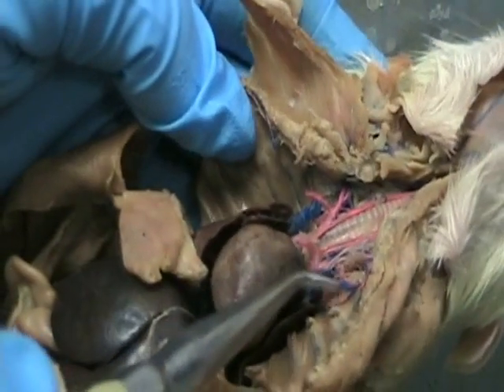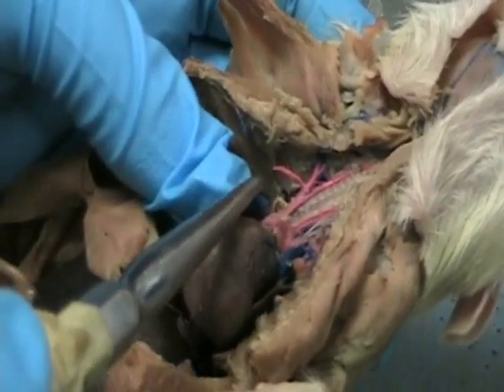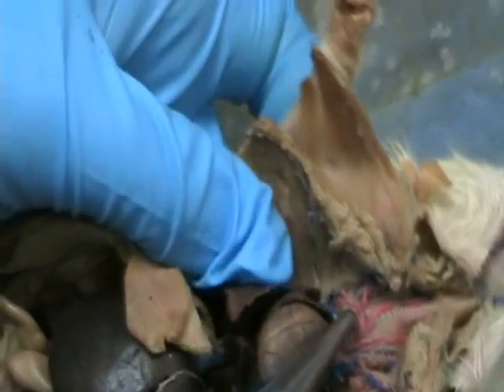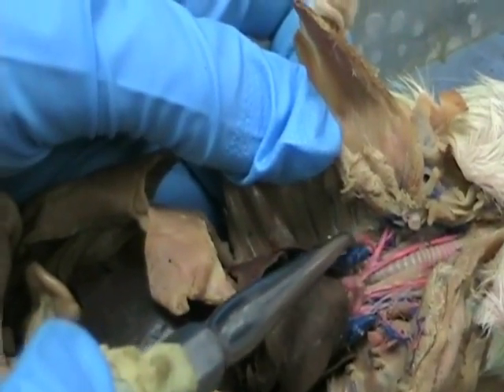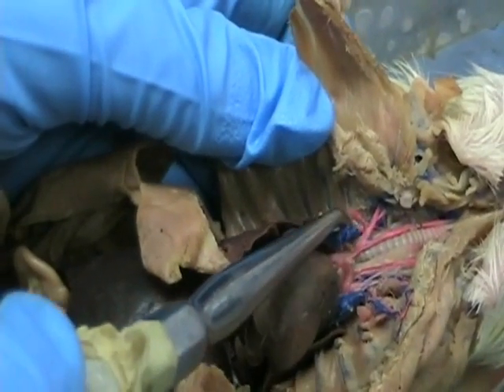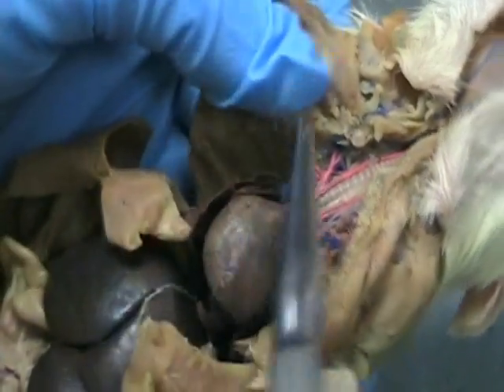So this one they call the internal thoracic artery. Okay, so this one's just the stub left. The one going down and away from you behind it, you'll feel a rib that you broke kind of in the way. You can feel bone. That's going to be the costocervical artery. Okay? So one coming towards you, one going away.